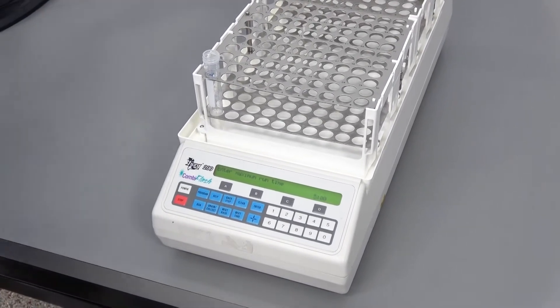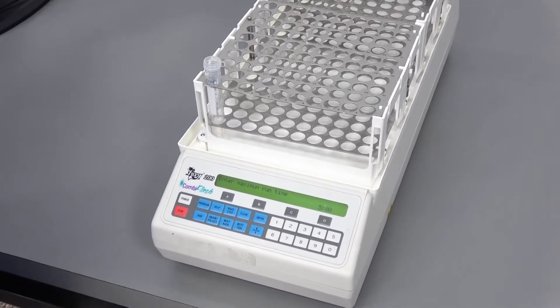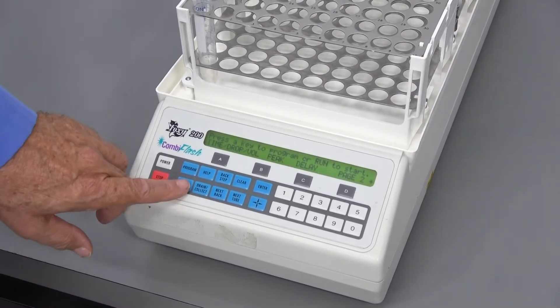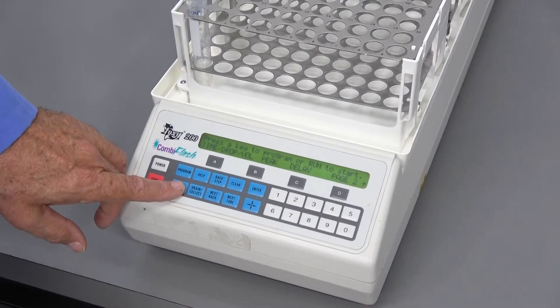And then how long for the entire process before it times out. If that's what we want, we press enter. We can go ahead and press the run key and it will start its program.